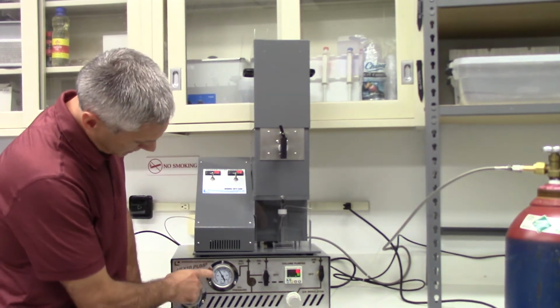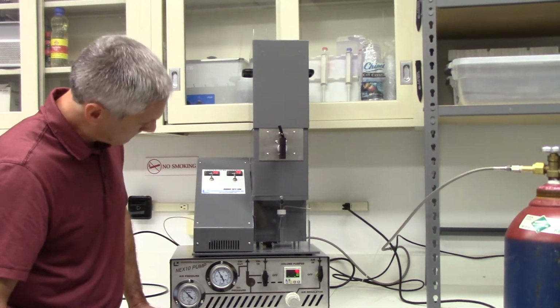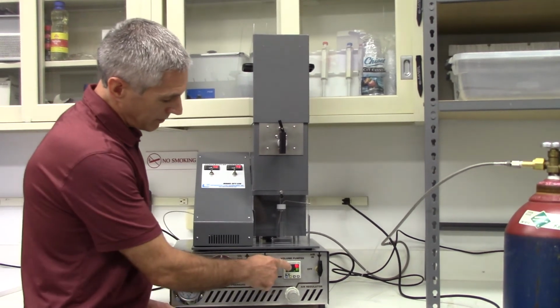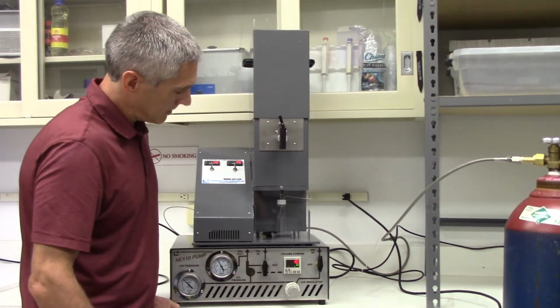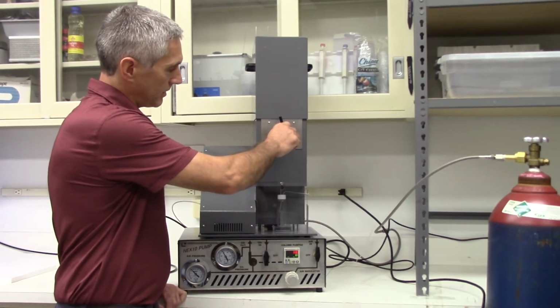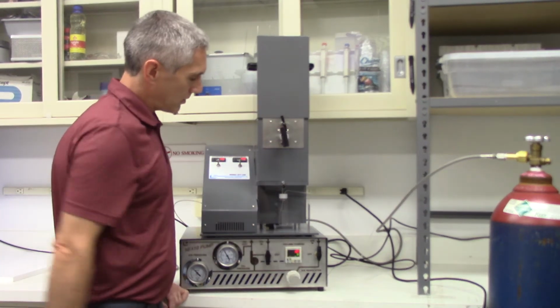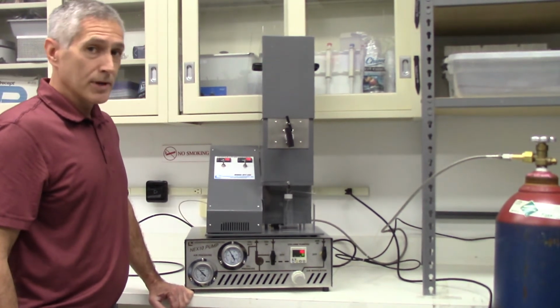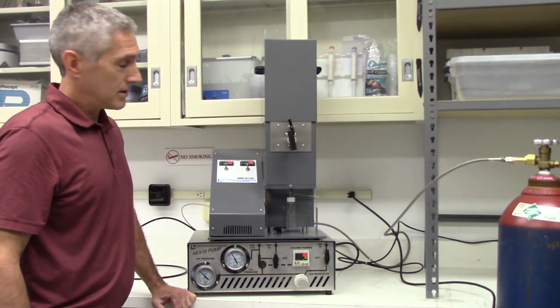So our pressure is still around 4,000 psi. We're flowing through the system. We're capturing every pump stroke. Every pump stroke is adding the milliliters of CO2 flow through the system. At this point, we're flowing dynamically.